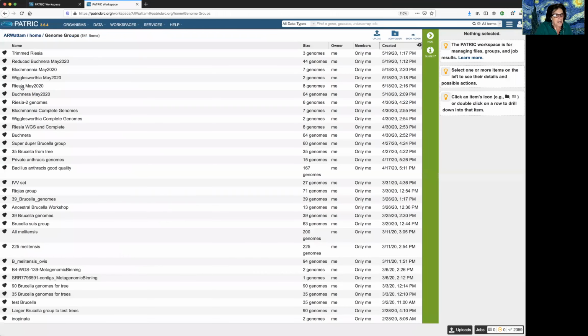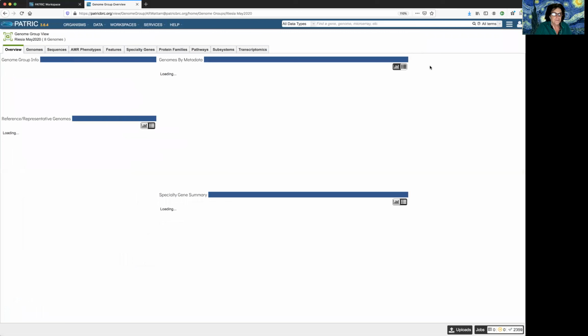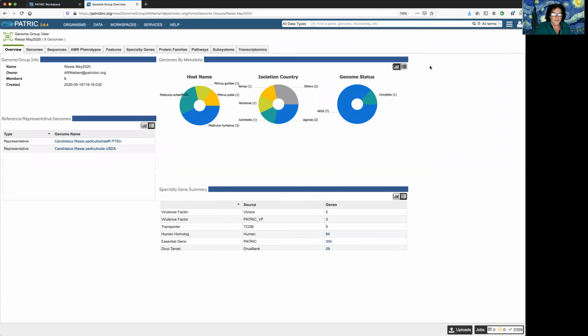So I'm going to go back to that group I created here, click on this, and when I select this group, there's a number of things I can do with it, but I want to do the group view, the genome group view. So I click on this. And this is a pretty clever way of looking at all your data. It's all assembled. It's the same thing as any taxon landing page. It's showing you for your group all the data that's there. But we want to go into the genomes.